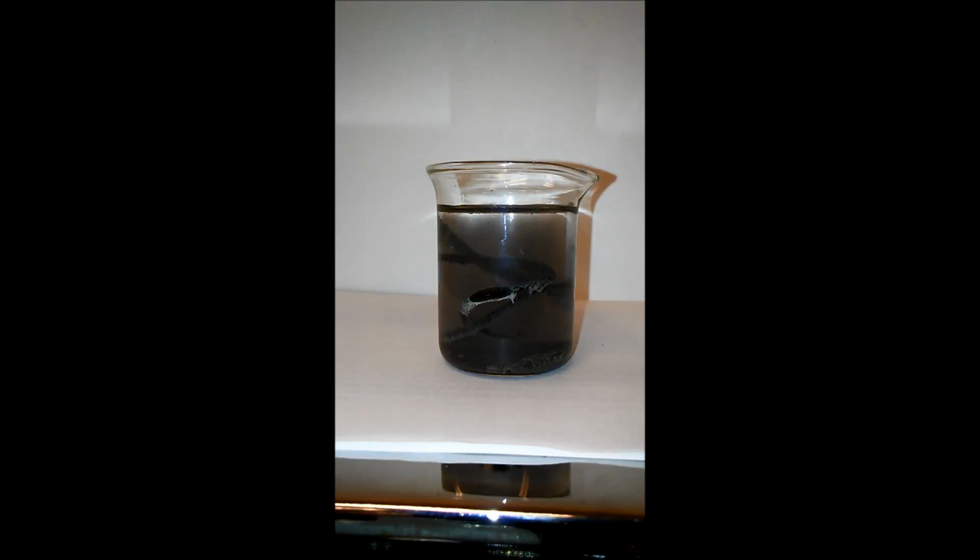Anyway, if you take a look at last period's here, and again, I'll have the video posted on Classroom later today, you can see there's a copper wire here, and then you can see the silver metal that has come out of solution. And the solution started out like this one here, a little bit clearer, but a clear to cloudy solution like that. And here it's turned obviously a blue color. That's because what's happening is as the silver undissolves, the copper is dissolving. The copper is going into solution, and copper solutions tend to be a bluish color.